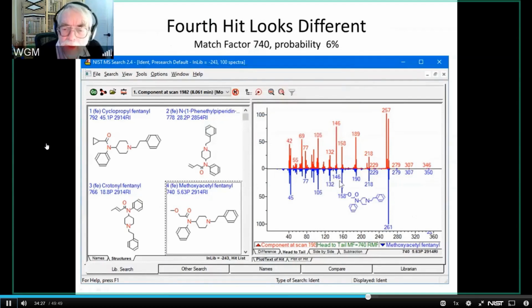Now, notice that in all of these, maybe you didn't notice, but let me just remind you that in all of these, most of this region here, up to about 158 or so, was pretty common. It basically got it all well. The problems were with the higher peaks. And in particular, we were missing this 261 and the 218, and the 158 had fairly poor matches. But now suddenly we've got the reverse situation. We don't get the 257 in this thing. We get a really good 218, and we get a good 158.